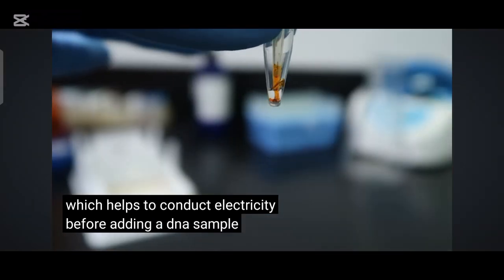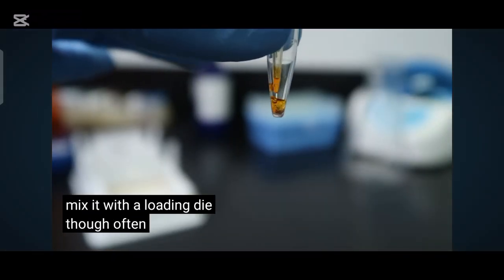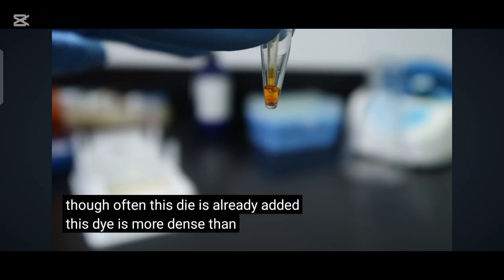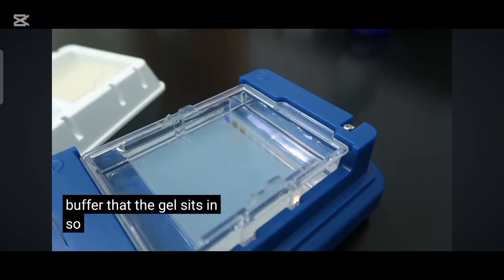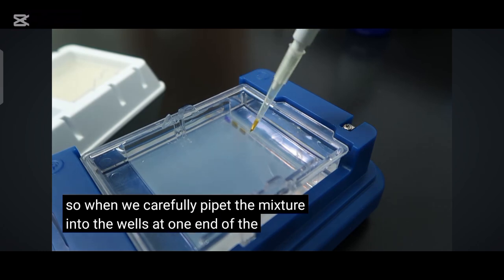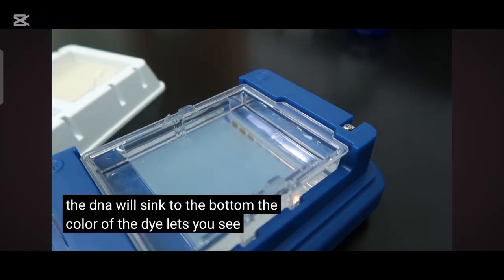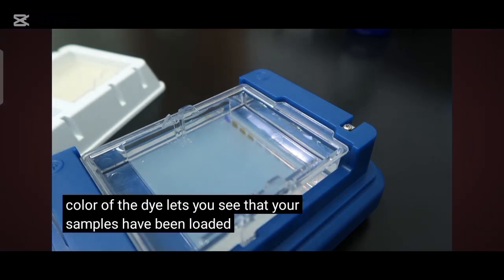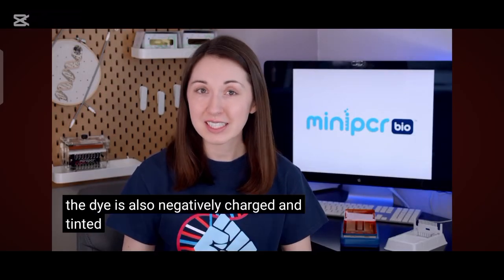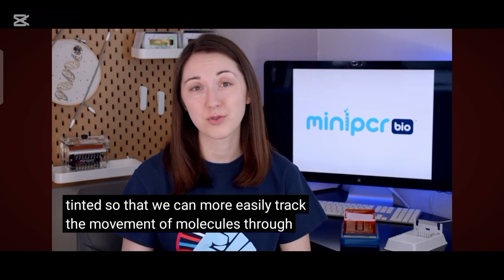Before adding a DNA sample to our gel, we mix it with a loading dye, though often this dye is already added. This dye is more dense than the running buffer, so when we carefully pipette the mixture into the wells at one end of the gel, the DNA will sink to the bottom. The color of the dye lets you see that your samples have been loaded properly into the wells. The dye is also negatively charged and tinted so that we can more easily track the movement of molecules through the gel.